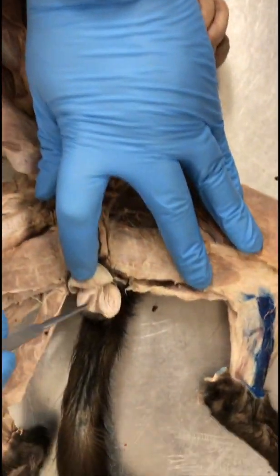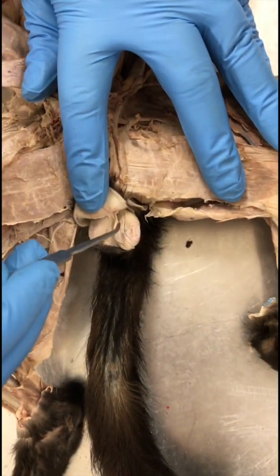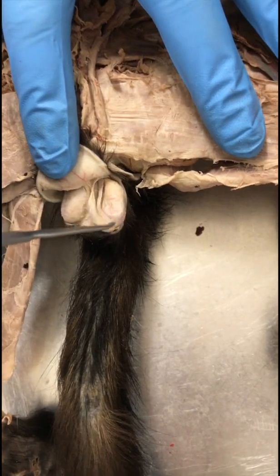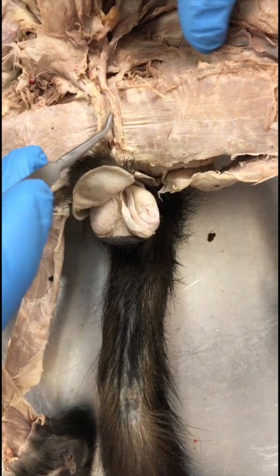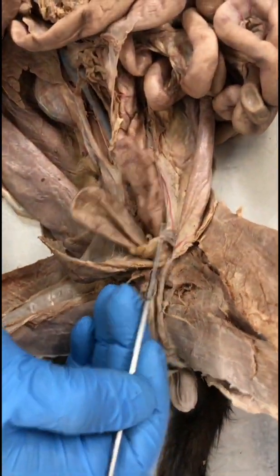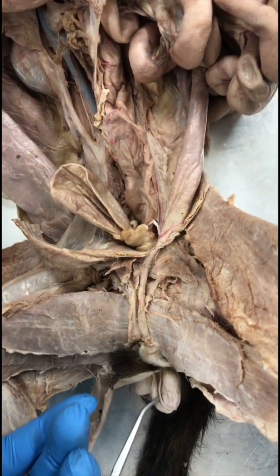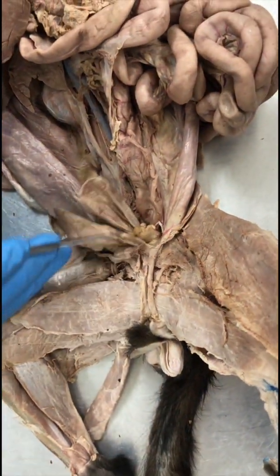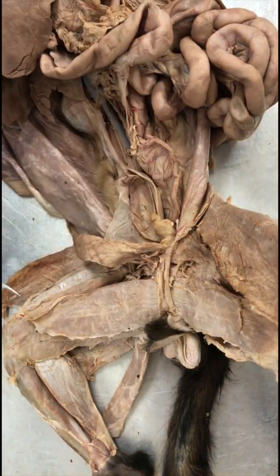So these will be the testis right here. Epididymis. So the tube that surrounds the testis, this would be the epididymis. Okay, so it's here, epididymis. It kind of goes up, and it forms into the vas deferens. So the vas deferens is kind of arising out of the epididymis and kind of goes back into the urethra. So the urethra ideally should be somewhere here, but it's not visible. It should be somewhere here underneath.